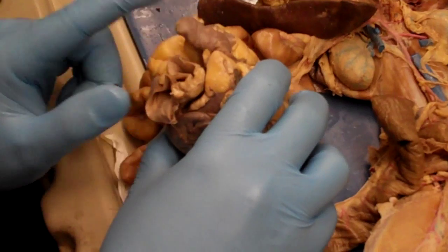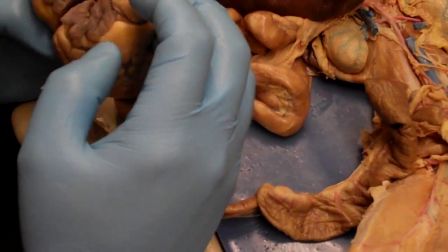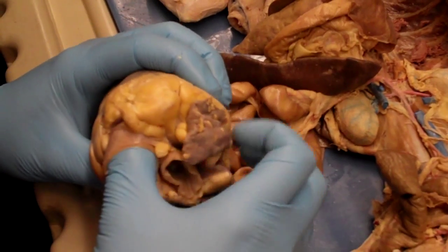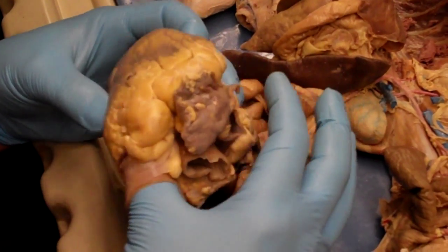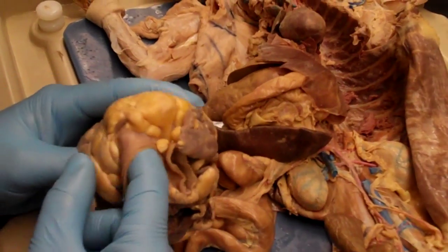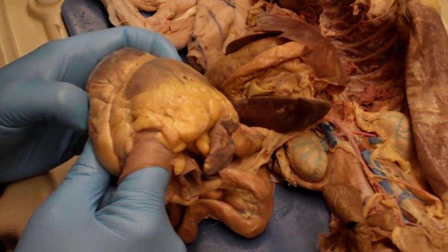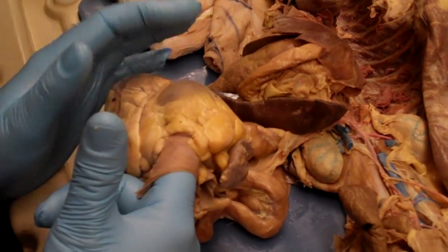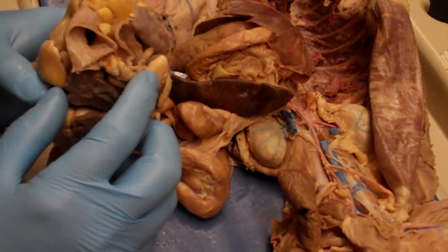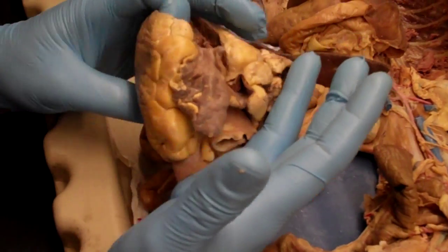I mean, the other thing you can do, too, so the aorta is going to be closer to the left auricle. So this is the left auricle right there. Actually, you know what? I'm just realizing I'm saying this backwards. Yeah, I would go by the circulation and actually putting your finger in, or I'd make it clear on an exam. Okay, you want us to stick our finger in and do an exam? Potentially, if I'm asking to identify a valve or something like that. If it's something I wouldn't want you to touch, I'd have to open it up or somehow make it clear where it's going. I could put a probe in or something like that and make sure that you could see where it's coming out or something along those lines.